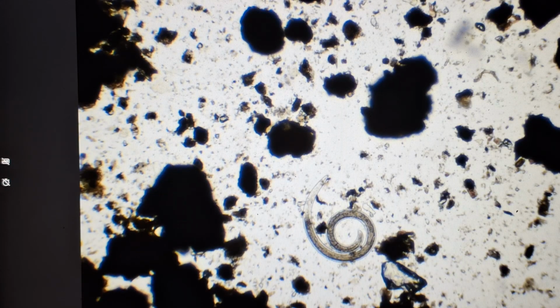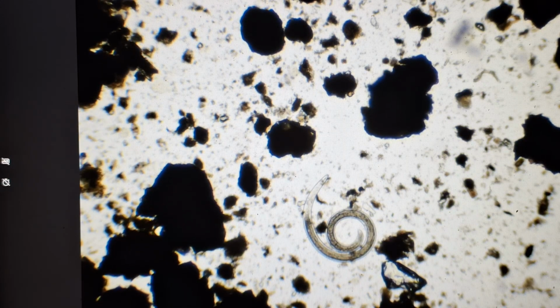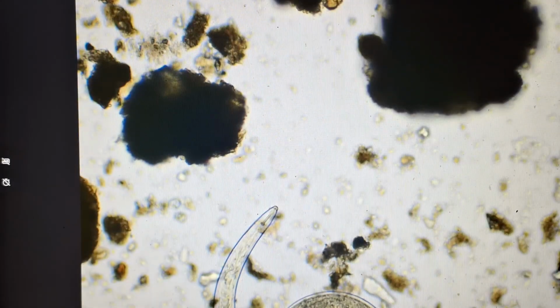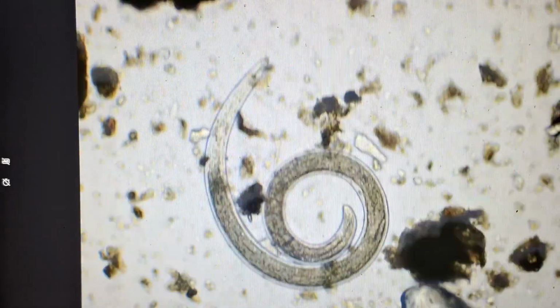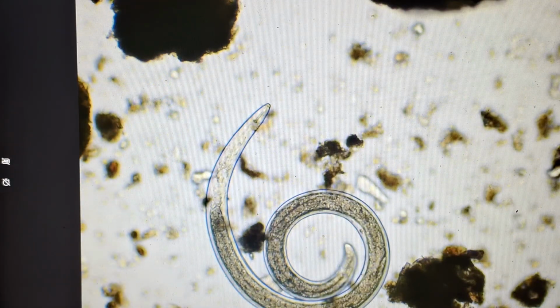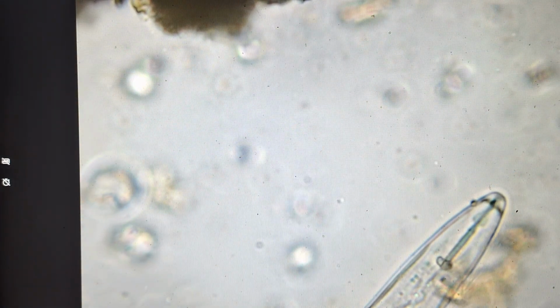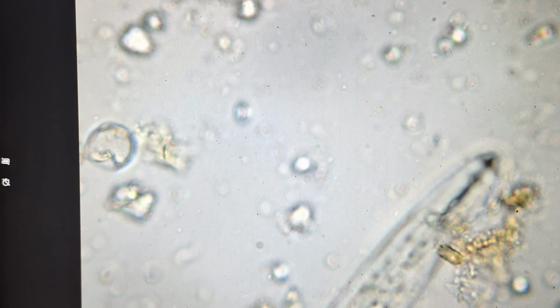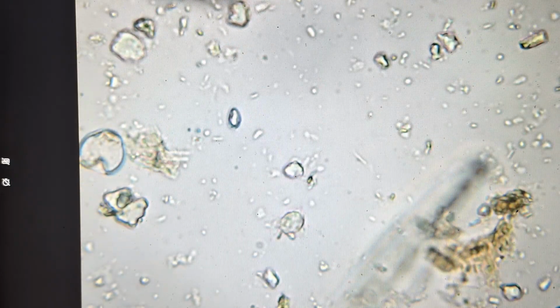Well, my slide's drying up, so I thought I'd take us back to the top. We see the nematode here we started with. Zooming in, seeing its mouth parts, tell what type it is. Identifying this one as a bacterial feeder from that mouth. Ooh, real touchy at 400x. There we go. There we see that mouth. And in the background, we see all the bacteria.